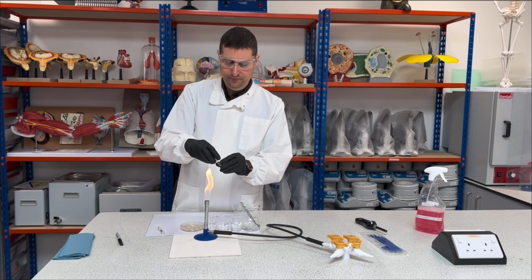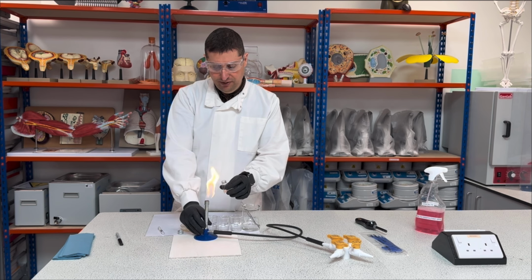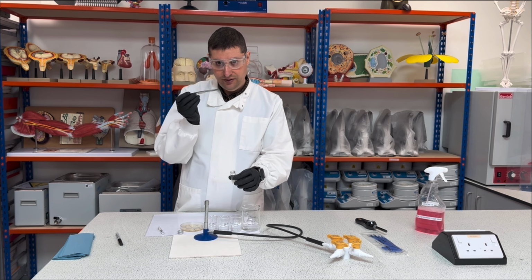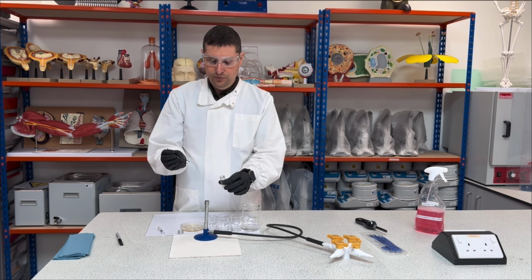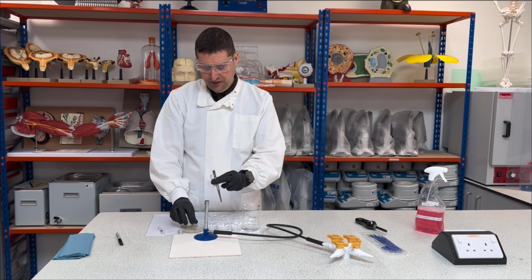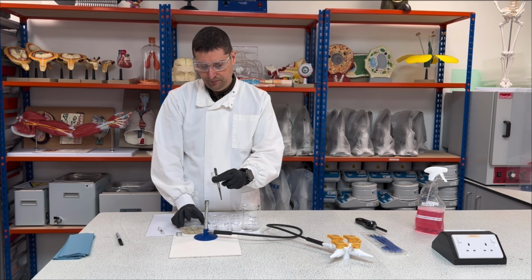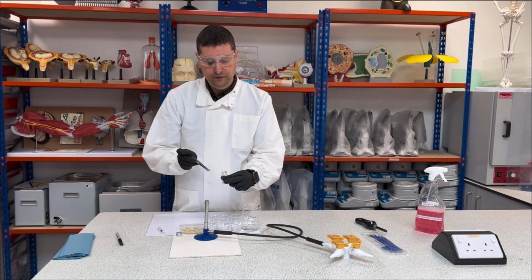I will open this up, close to the flame. I will change the flame to blue, okay? And then I will take my tweezer. I will remove the excess of ethanol, wait a little bit to dry, and flame it, okay? So now I can open my Petri dish and keep it this way, okay? So I have here V, okay? So I will go for vinegar first.